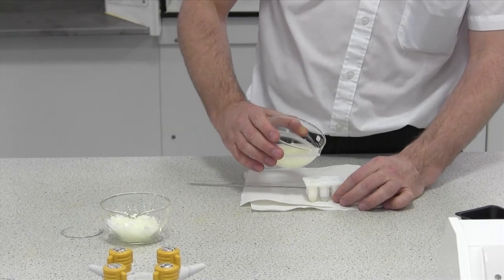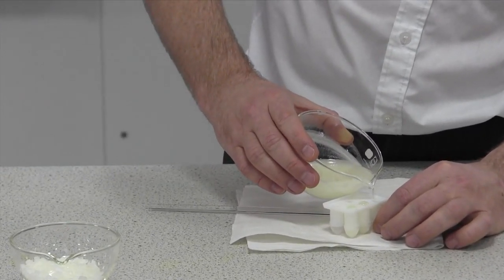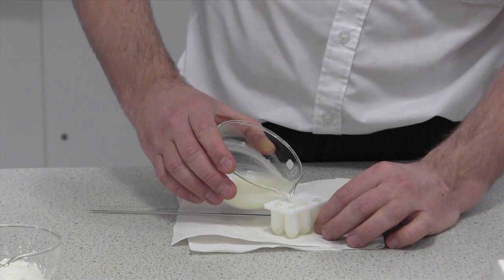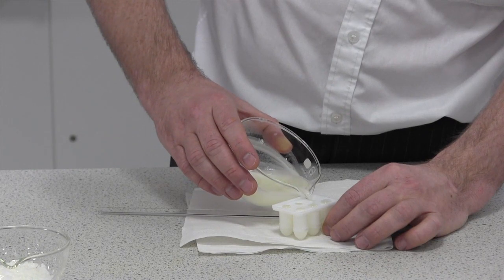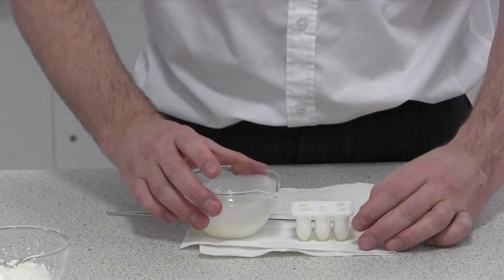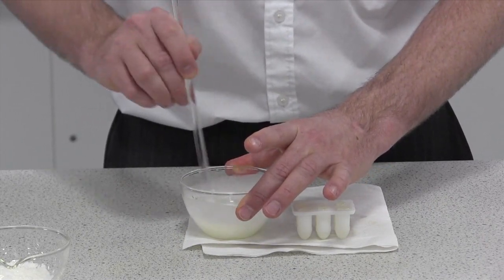You're going to need to overfill it slightly. As you can probably tell, the tops have started cooling and hardening. And you can also tell that if you were to pour another set of moulds, you need to re-agitate your powder and base.